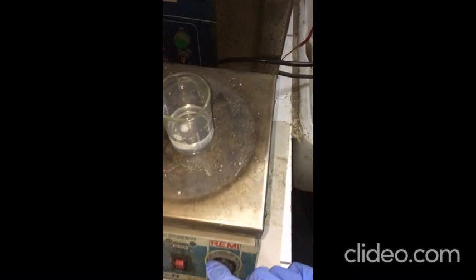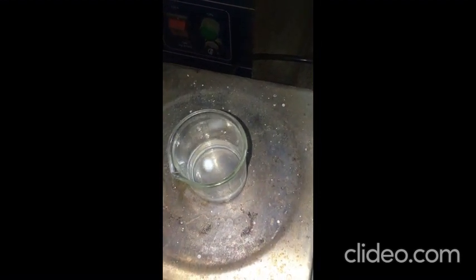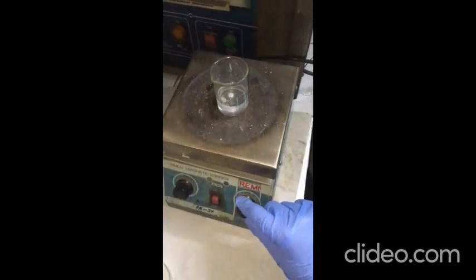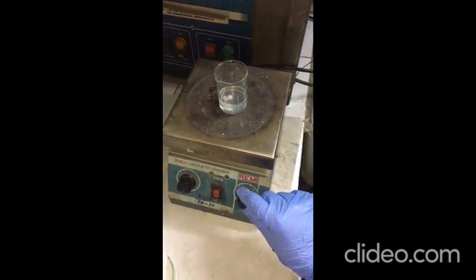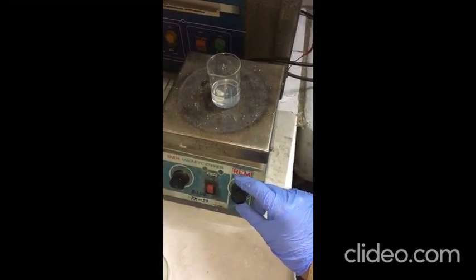You can see that the stirrer is running. The solution will be mixed after some time. You can change the rotation speed.